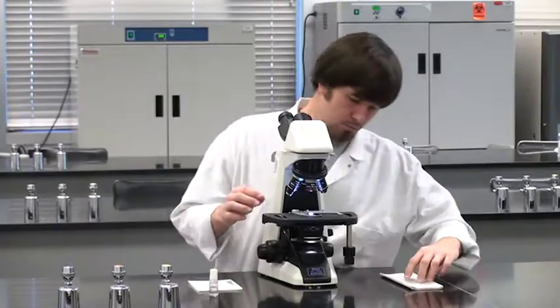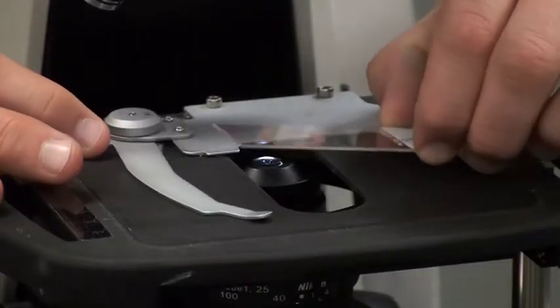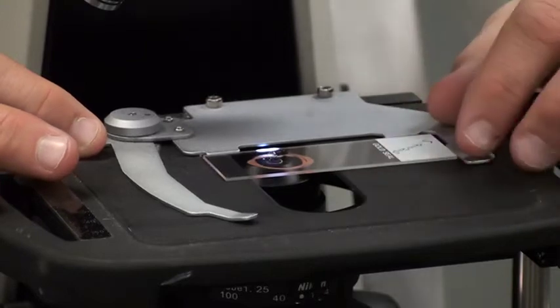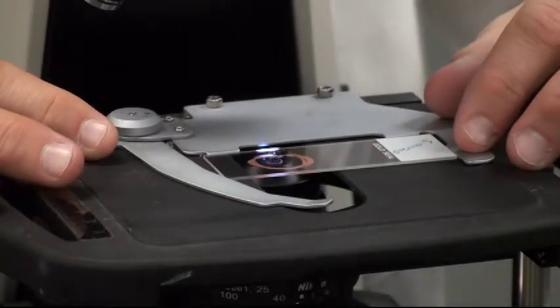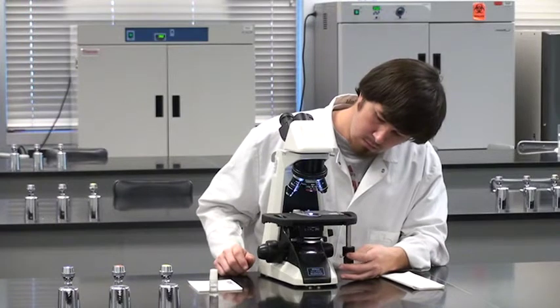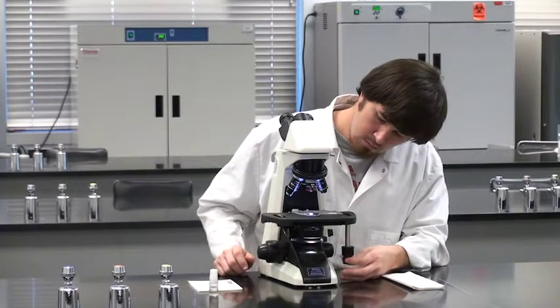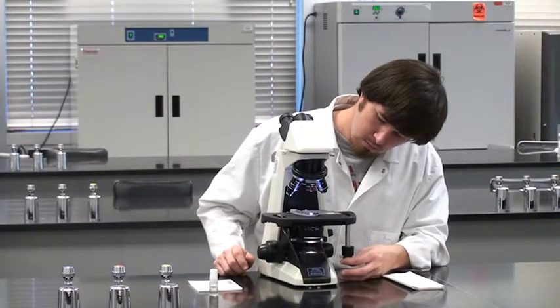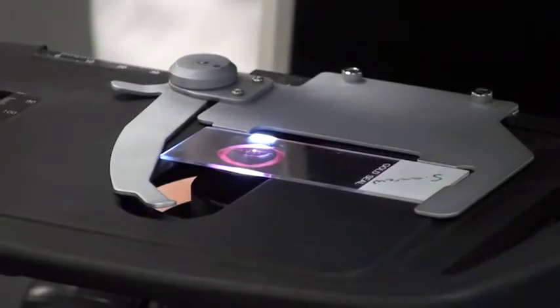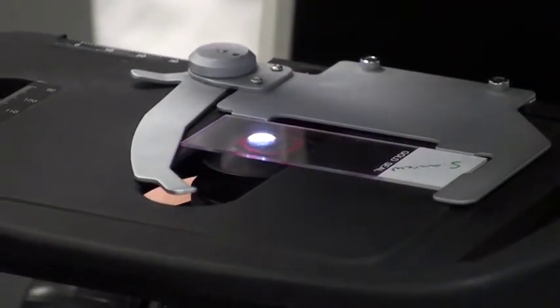Hold the slide clip open with one hand, place the slide next to the guide frame with the other, then release the slide clip so it closes slowly. Move the specimen area of the slide over the condenser by looking directly at the slide as you move the stage with the XY knobs. The specimen is in viewing position when you see the light shining through it.